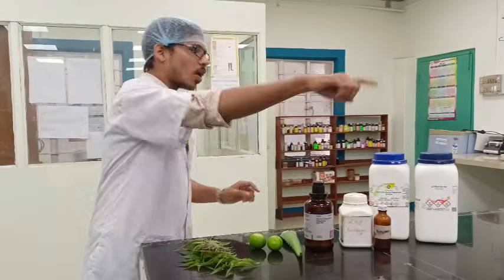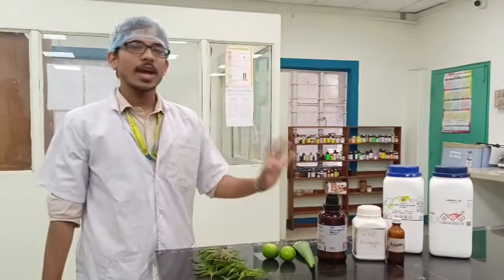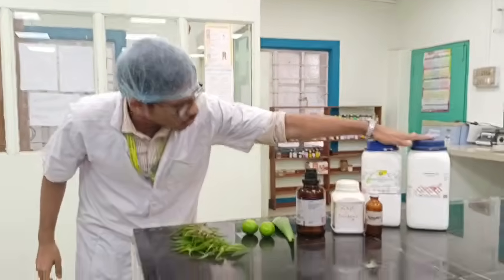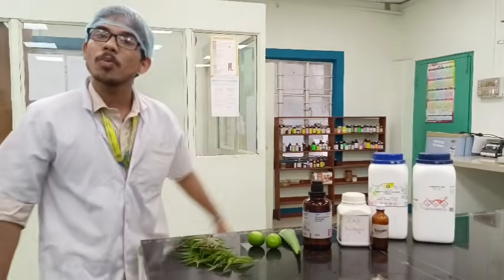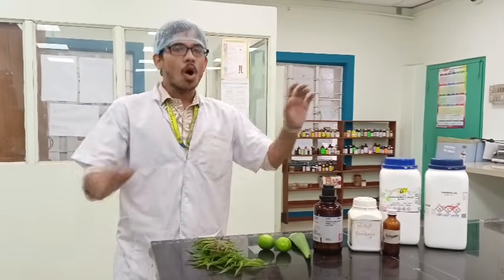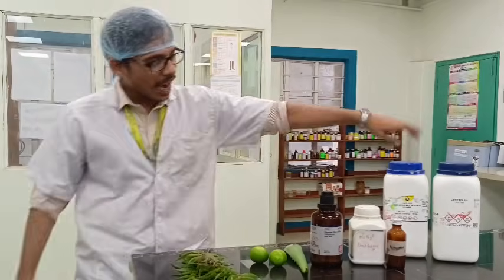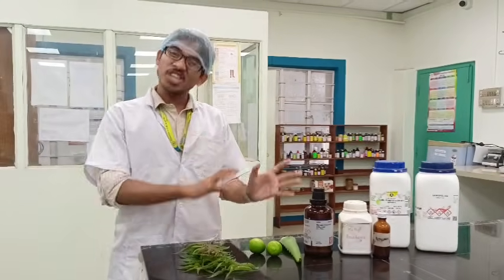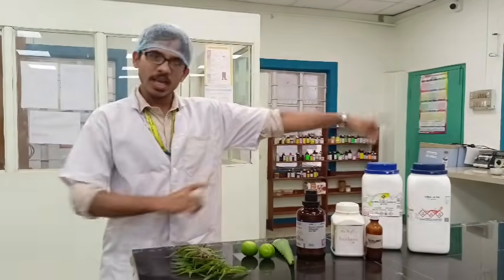Now we are going to the chemical entities. At first we come to our main two things. Number one, SLS, sodium lauryl sulfate, and number two is carbopol. These are the main ones because SLS is the foaming agent or surfactant. We use it to have foam in our hand wash, and carbopol is mainly the gelling agent. We know that hand wash is a gel-like preparation, so to create that kind of jelly preparation, we are using carbopol.